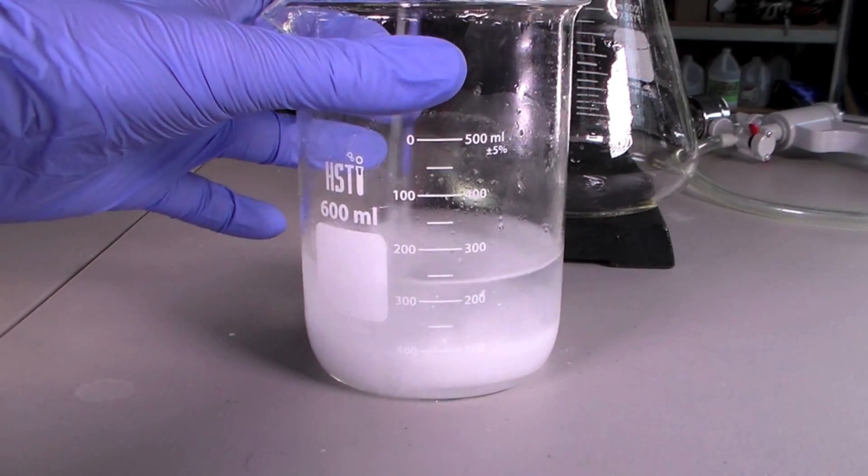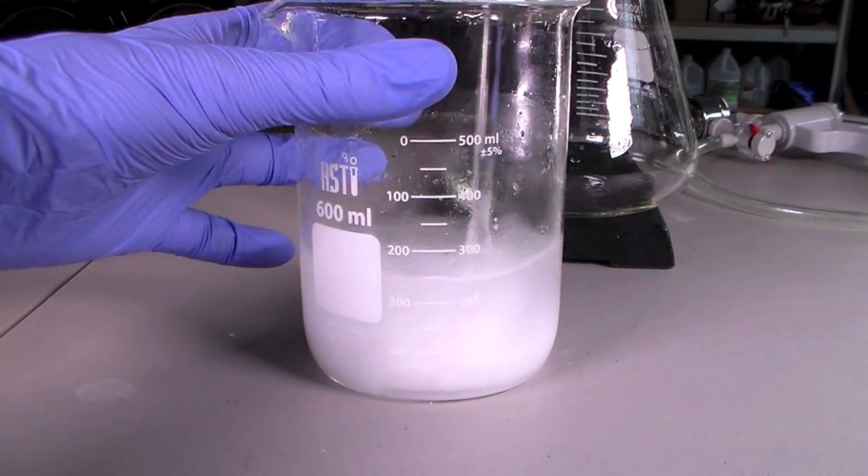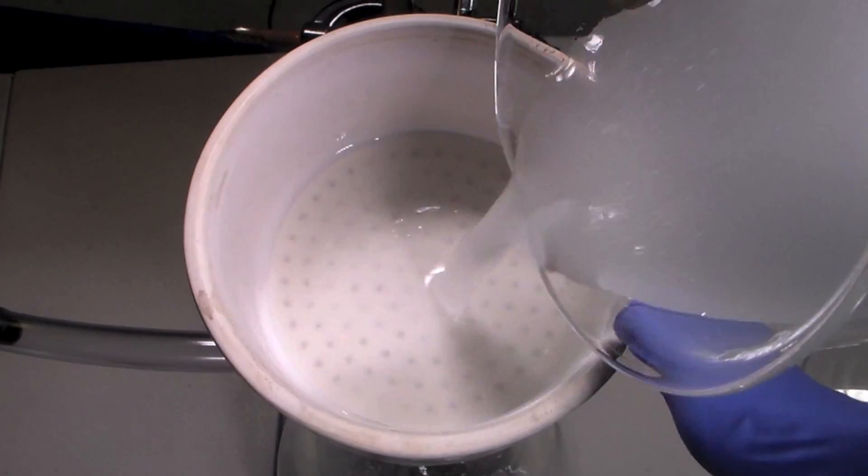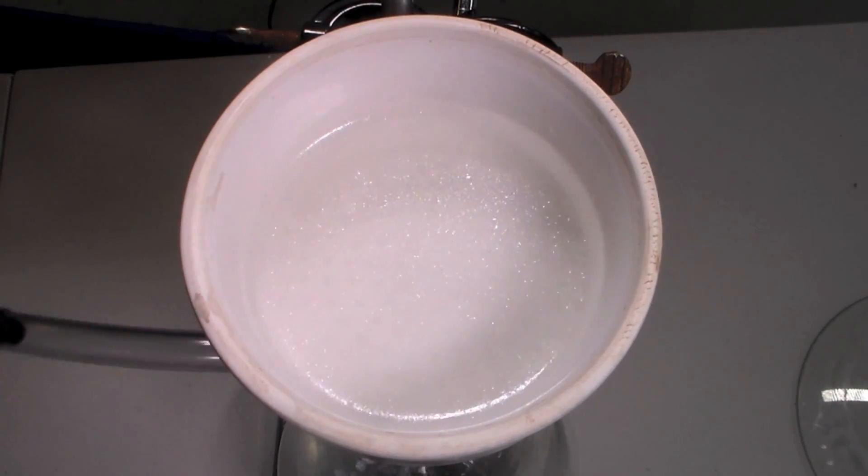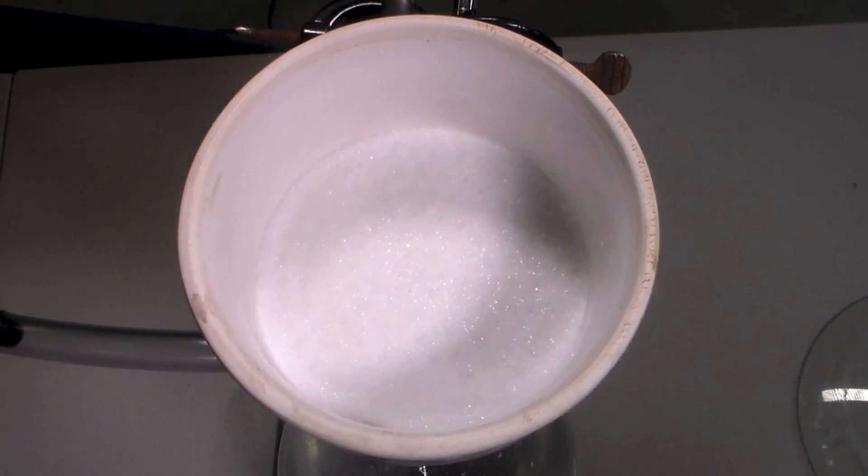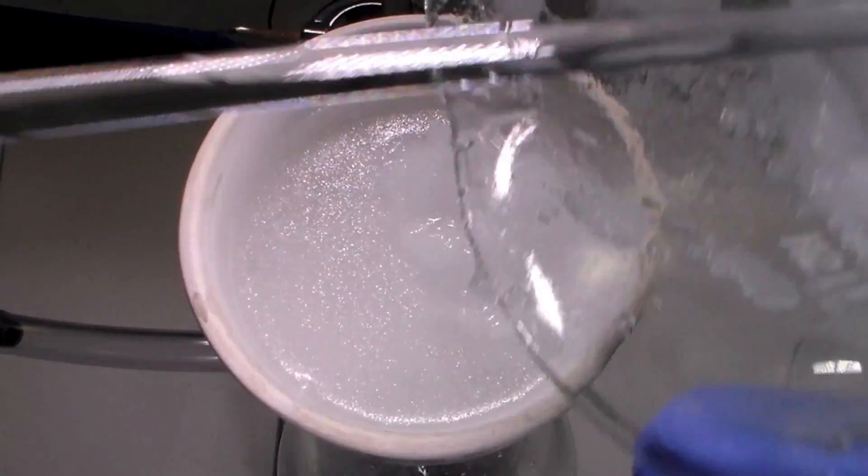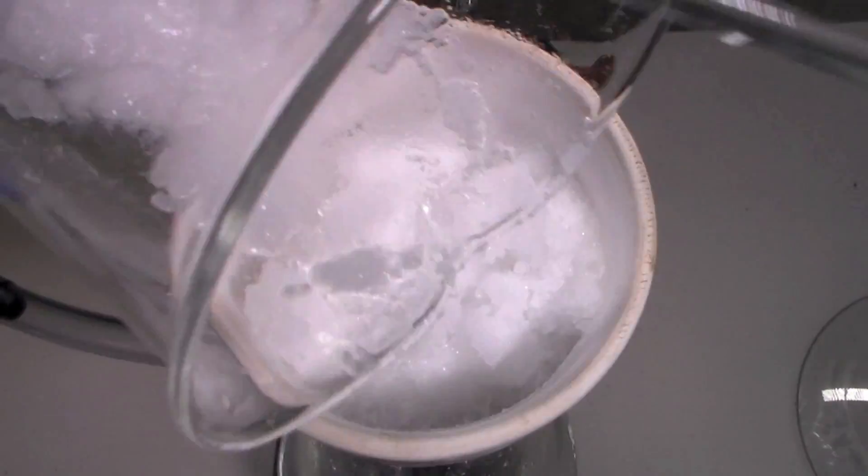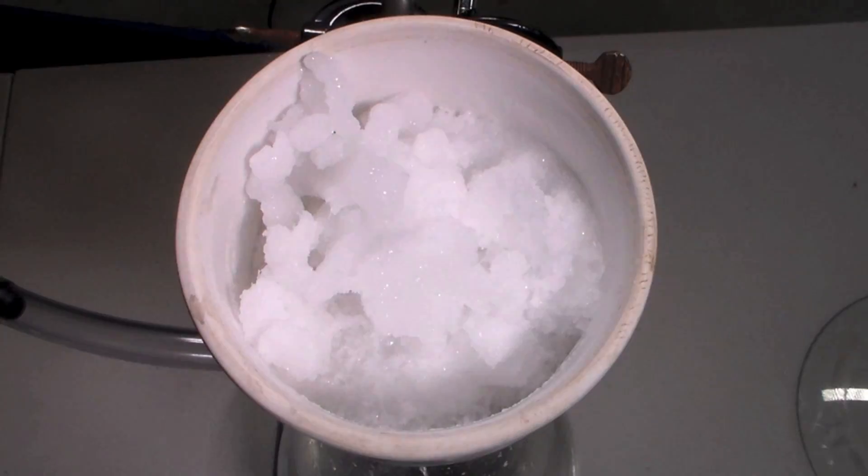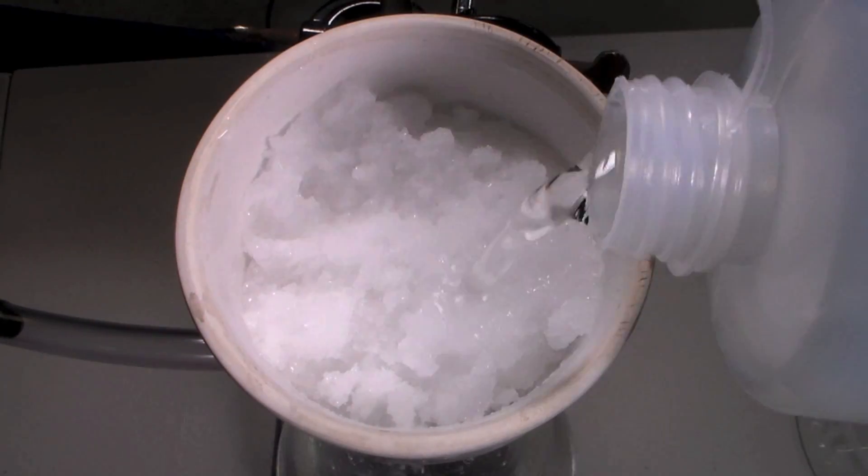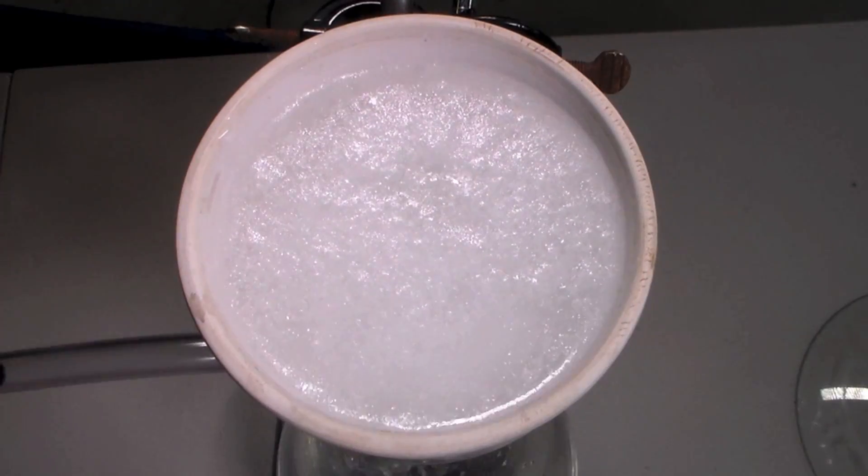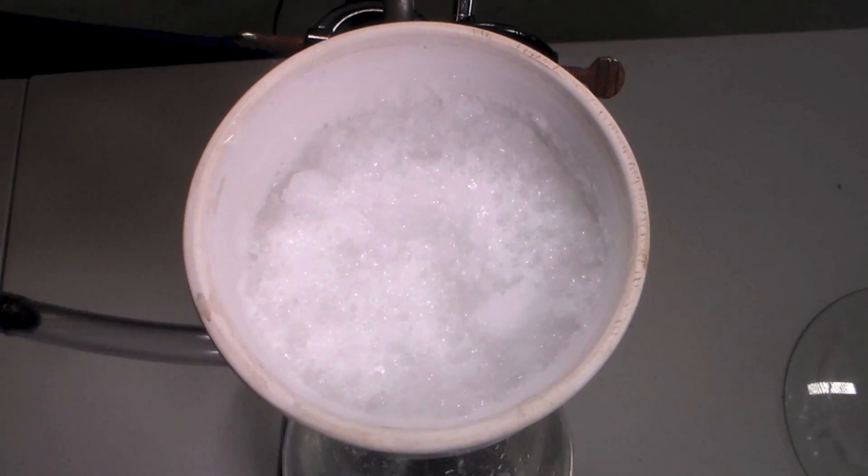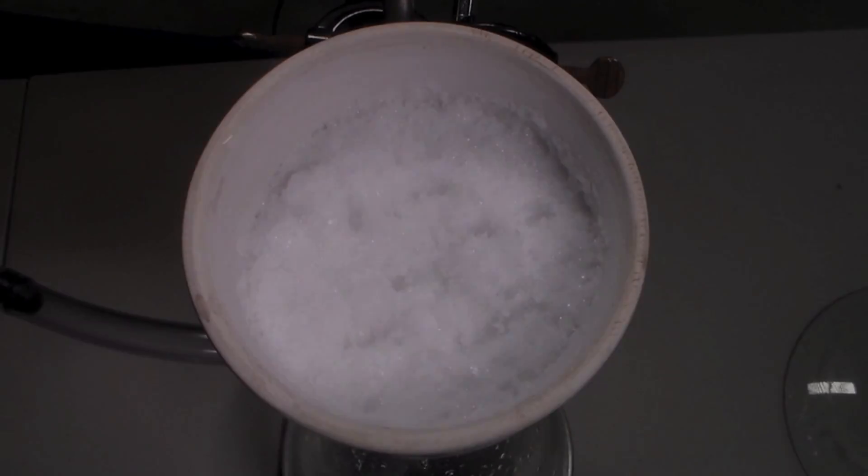The crystal deposit was broken up using a glass stir rod. The mixture was then vacuum filtered. The crystals were then washed with a little bit of cold water. Make sure not to wash the crystals too much or you will begin to dissolve them.